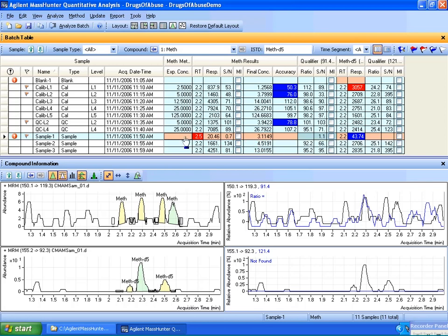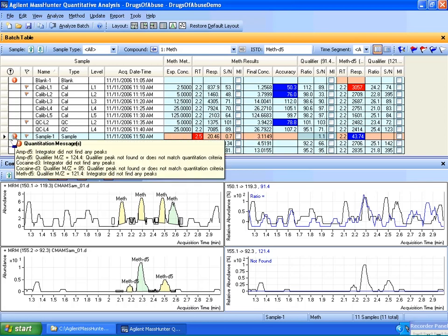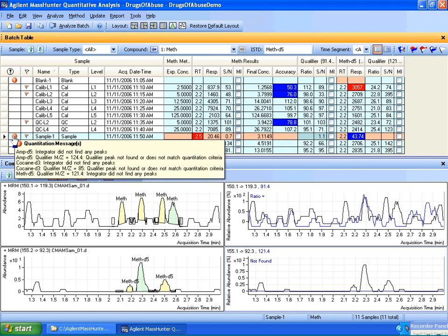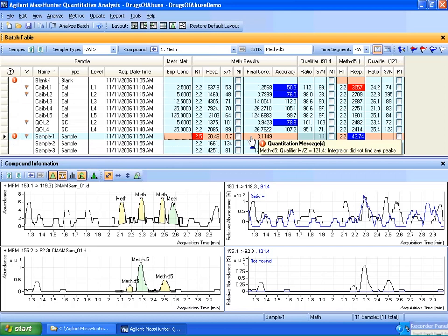So in summary, I've made a distinction between the quantitation message function and the function of the outlier, and explained why certain rows would be colored red that are associated with the quantitation message telling you that peaks are not found.